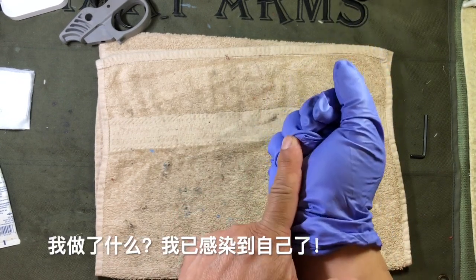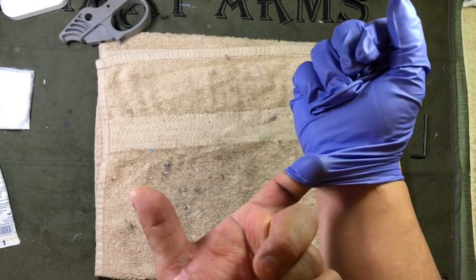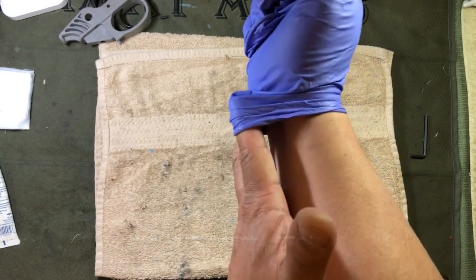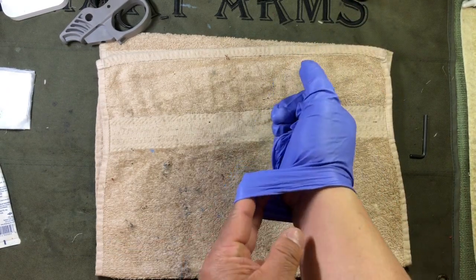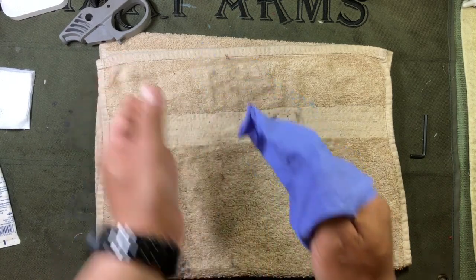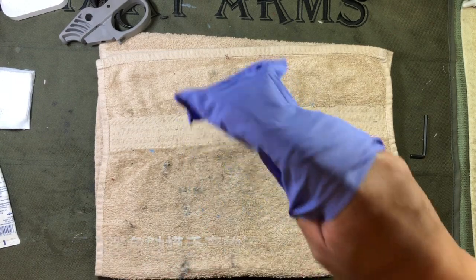Be gentle and be careful when doing this — if the glove is tight and you force it, you've contaminated yourself. Get one finger in, then resist the urge to flip your hand around and pull, because if there's any fingernail or weakness in the glove, you'll pop it and possibly contaminate yourself. Keep your palm facing your forearm. Get one finger in, then a second finger, and notice how you're starting to open up the cuff. Maybe get your thumb in there to open it even more. Now with that cuff open, invert the glove very slowly and gently — notice my arms are moving in two different directions.